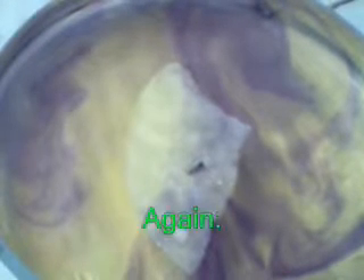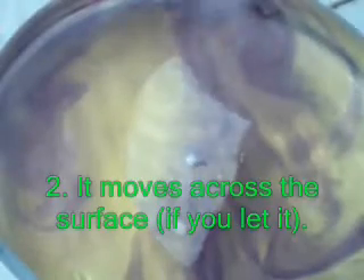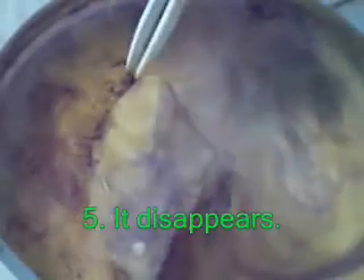There are several observations you can make. Firstly, it floats — not just on the filter paper, but the first piece floated on water. Then it forms into a ball, then it bursts into flame, then it reacts very strongly with the water. Now normally I would be doing this behind a safety screen, but because I'm taping this, I can't really put the safety screen up. So I'm taking this risk for you.